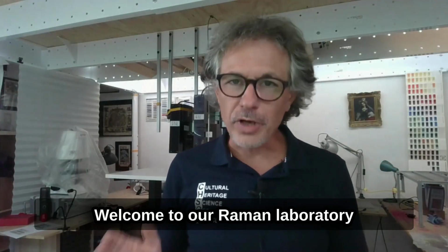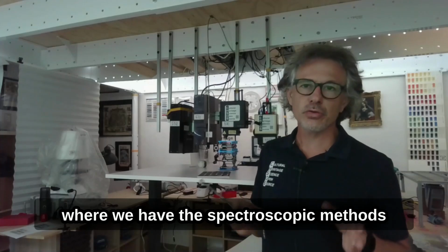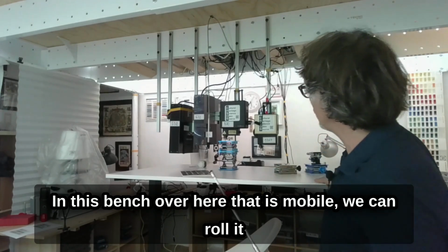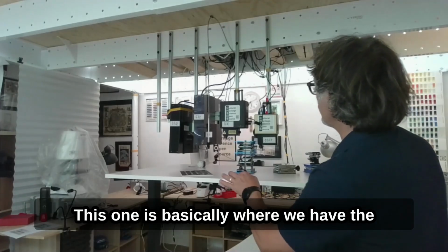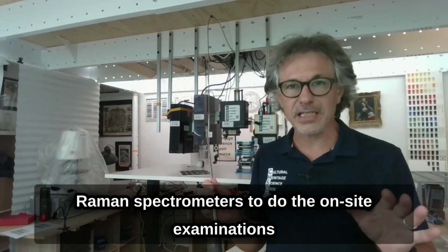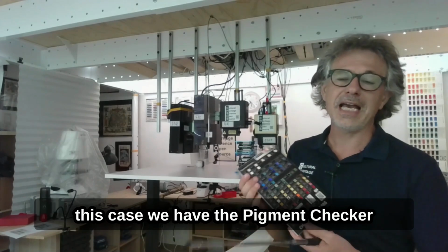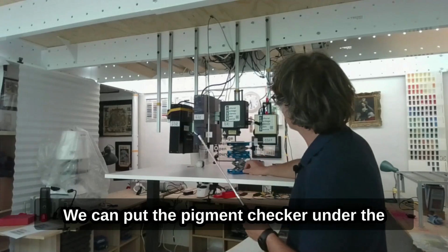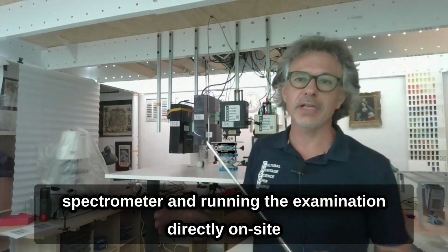Welcome to our Raman laboratory. Actually, this one is the lab where we have the spectroscopic methods. This bench over here is mobile, we can roll it, and it is basically where we have the Raman spectrometers to do the on-site examinations. So basically we can put, like in this case, the pigment checker under the spectrometer and run the examination directly on site.